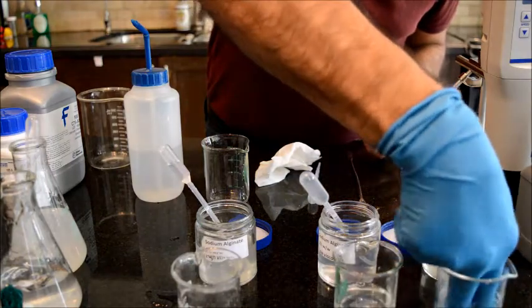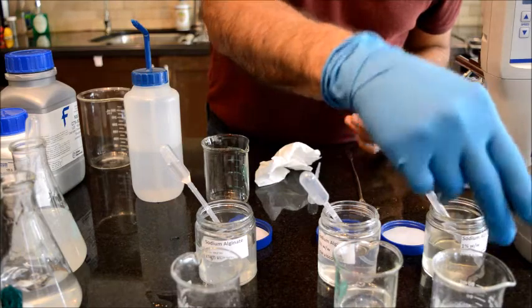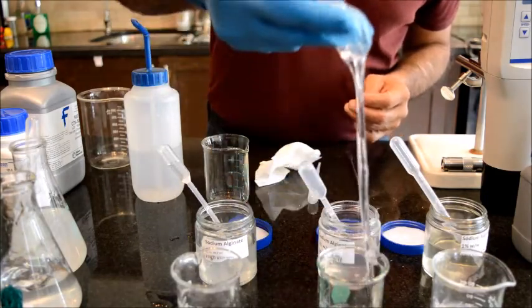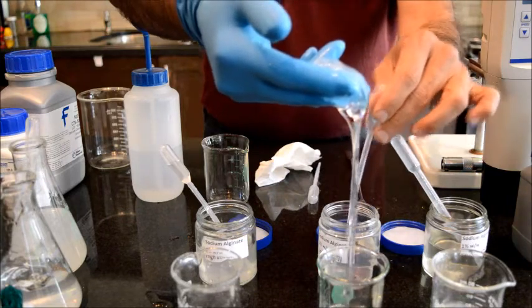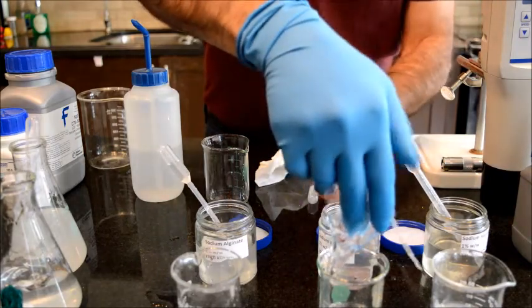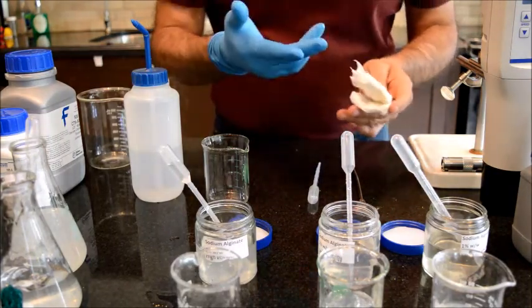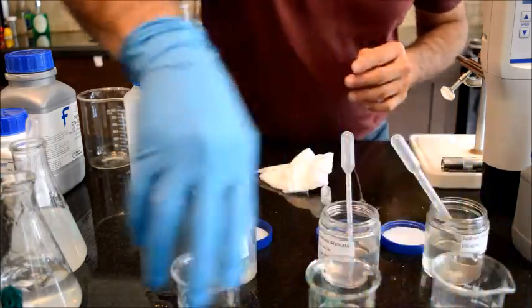And same stuff I can have here, a little bit more fragile. The structure is not as strong as the high density, and similar to the other one, you form a solid material, solid goo. So this goo for sure has a different structure than the one that we don't have calcium chloride. What is happening here is that the calcium will act as a binder and start to link the straight chain polymer of the alginic acid together. So you will start making this 3D structure.